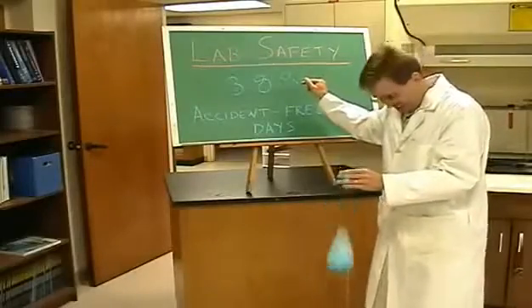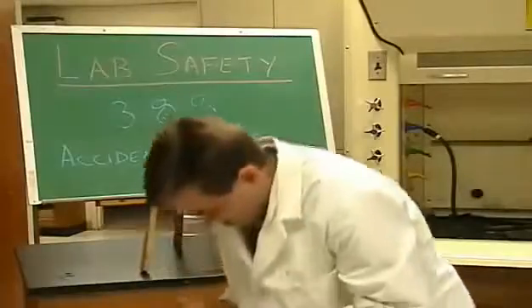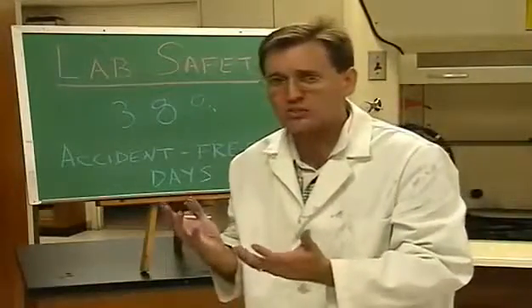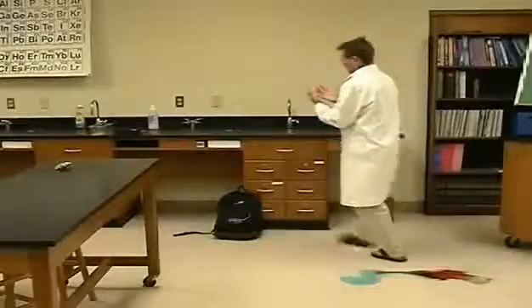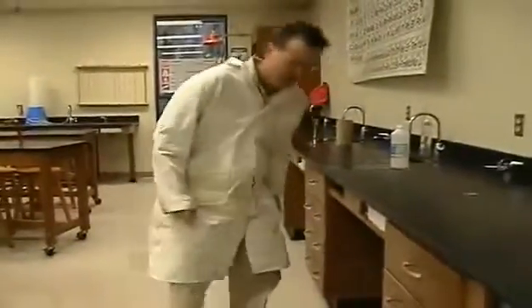That can't be good. It burns! That's gonna leave a mark. Practicing lab safety, I'm going to wash my hands at the wash area, and then I'm gonna bandage my foot. Thank goodness I have my glasses on. That's not water. Isopropyl alcohol. Ugh.